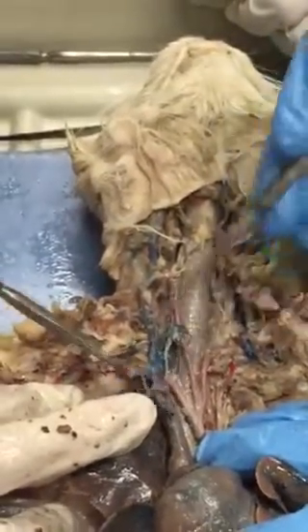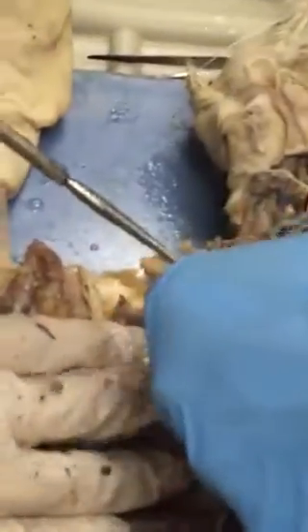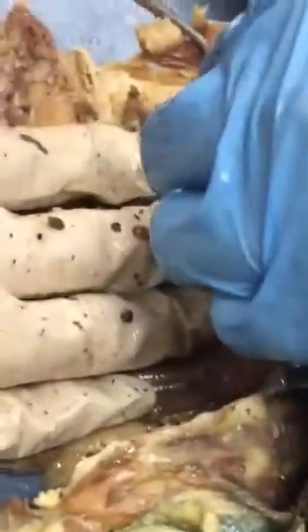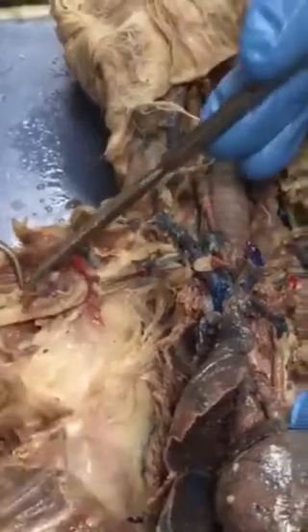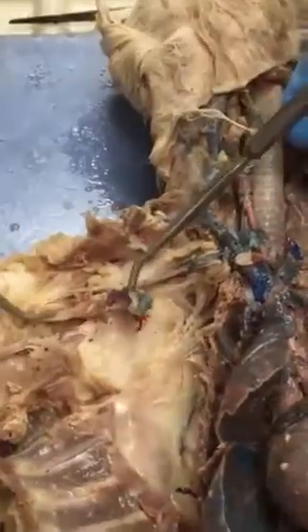It looks like we pulled some of the sheath or connective tissue around the artery off. Or you know what, this could just be pure latex mixed with some blood cells. So the vessel is the stuff around it, because vessels are tubes. Here we broke it off a little bit, but it would have been the same thing. So what would have been in the armpit area? Axillary. And if we're down here, it's got to be brachial. That's the extent of what I would probably ask you. Whatever's on your list.